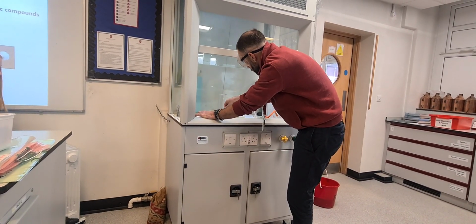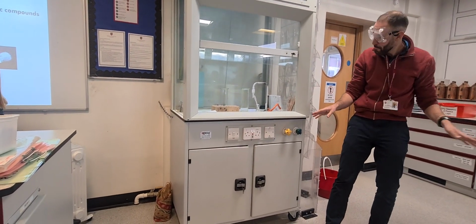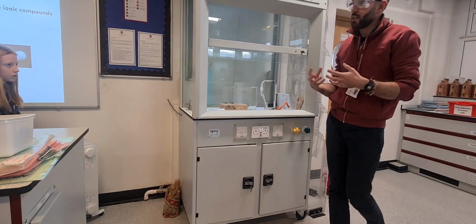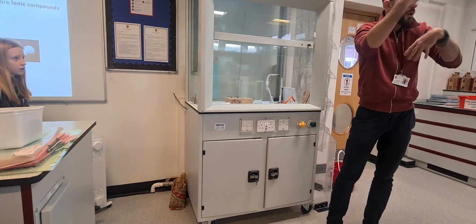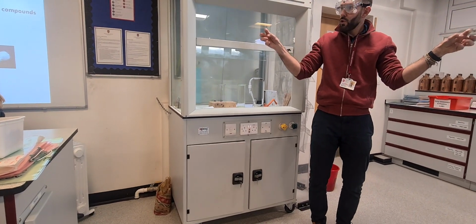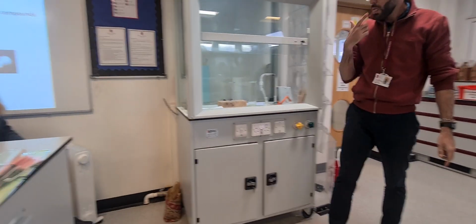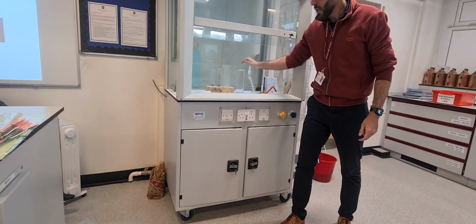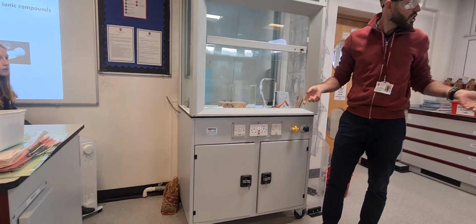So that's going to go on the little brick there, like so, and hopefully it's dried enough. We're going to put a little drop of water on it and it's going to start fizzing, and its exothermic reaction will get a bit of heat. Then I'm going to tip the chlorine gas over it, and there'll be enough heat to get it going, and we'll get sodium plus chlorine, salt. In theory we should be able to eat the salt and taste it. Two very dangerous things come together to make something that we can eat. Isn't that crazy? It's crazy to me anyway.